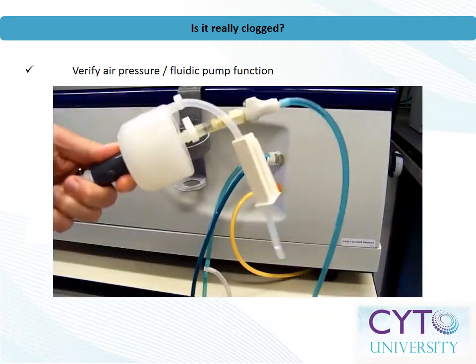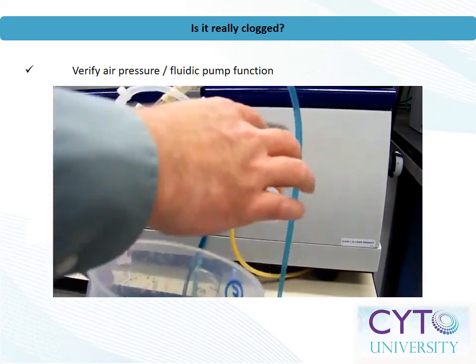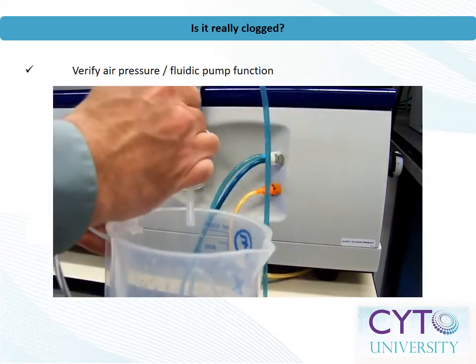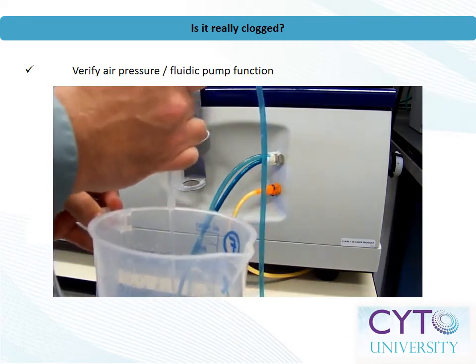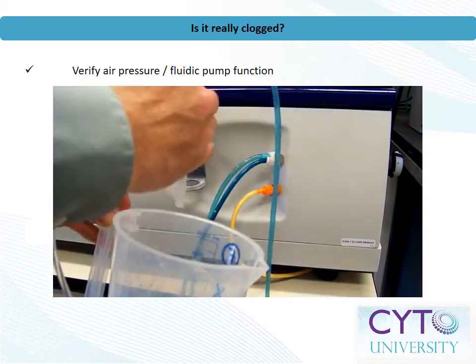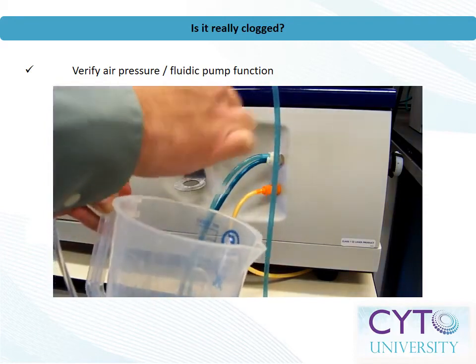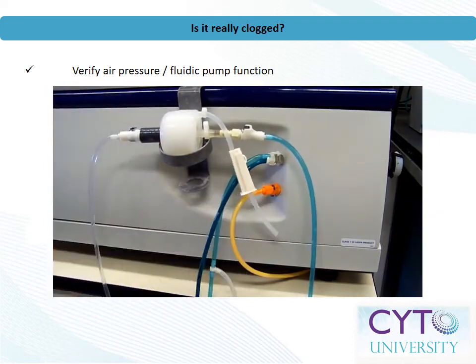Next, let's be sure no air bubbles have airlocked the sheath filter. Trapped air can typically be vented through a valve on the sheath filter. Carefully unscrew the vent cap or roller valve until only liquid escapes. If your instrument is equipped with a hydrophobic filter on the waste cap, check that as well to be sure it isn't wet. Back pressure can sometimes mimic clogs.